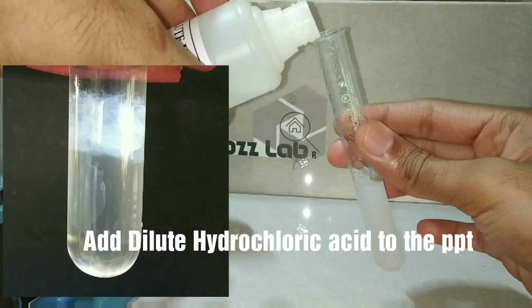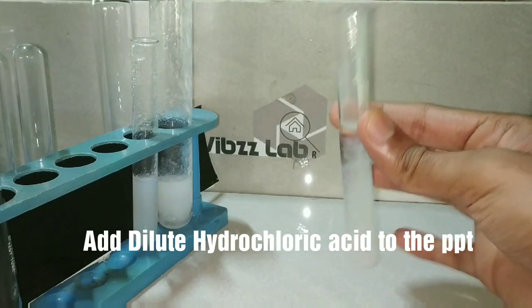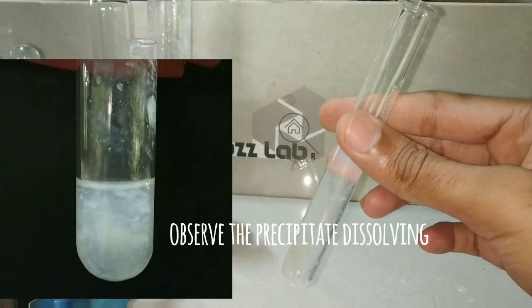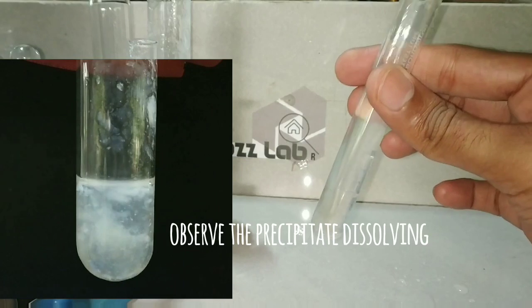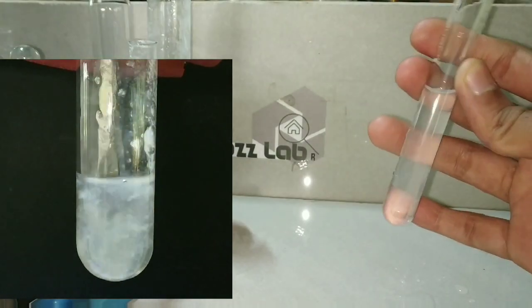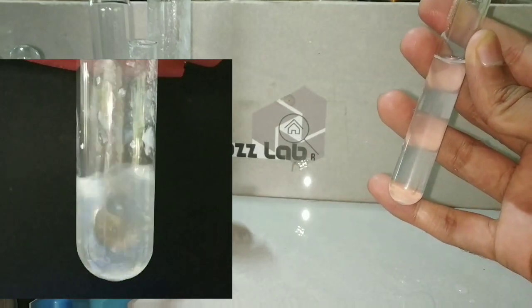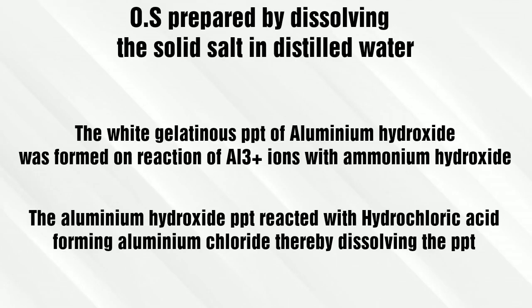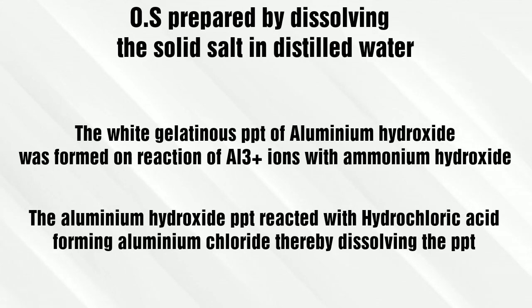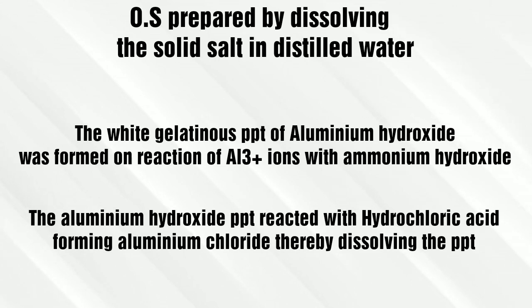Now we will be adding the dilute hydrochloric acid with the intention to dissolve the precipitate. You can see that on adding dilute hydrochloric acid, the precipitate starts to dissolve and soon the solution will become clear. The Aluminium Ions react with Ammonium Hydroxide forming the white gelatinous precipitate of Aluminium Hydroxide, which dissolves in hydrochloric acid.